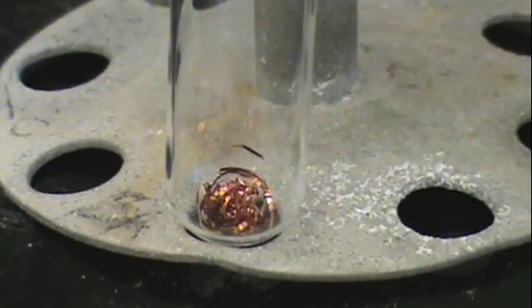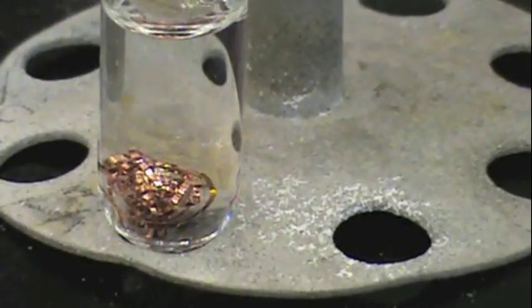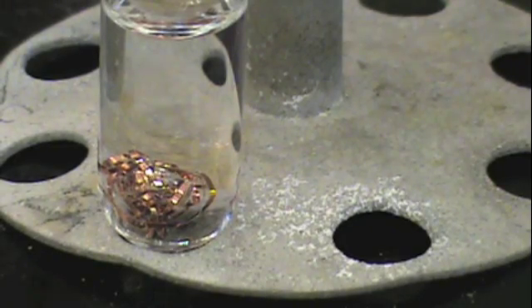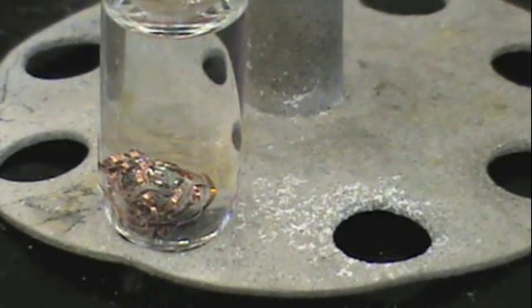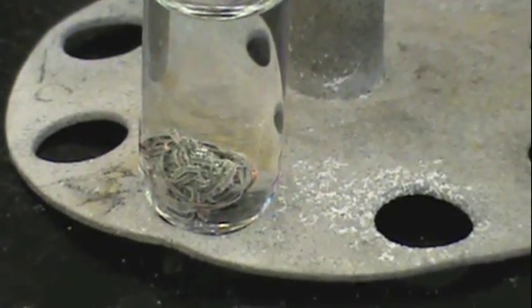The last reaction is that of copper with silver nitrate. Within just a few seconds, you begin to see the formation of silver crystals on the copper metal. And the copper no longer looks orange, but rather the silvery color.